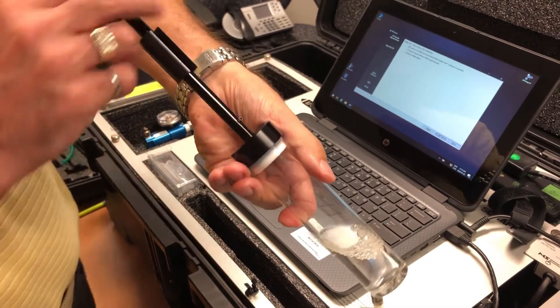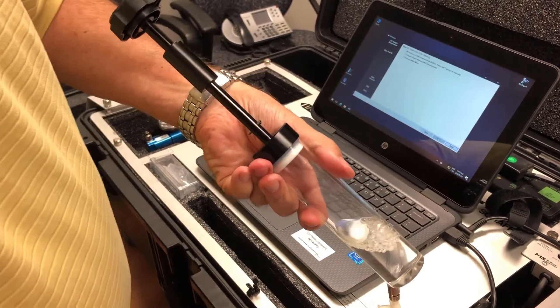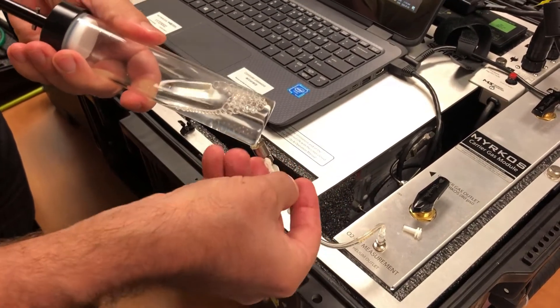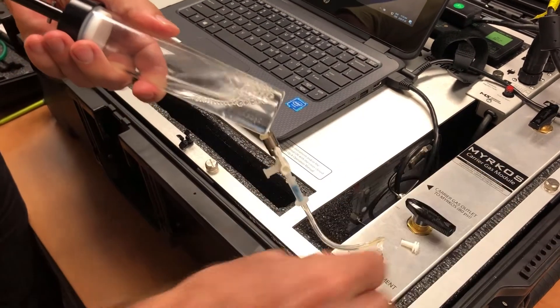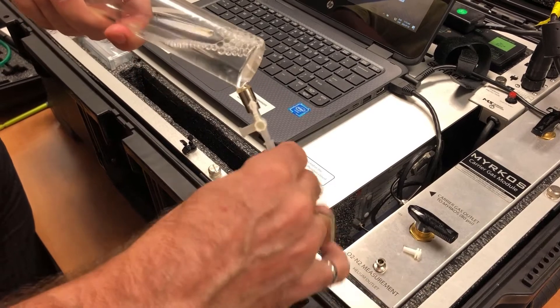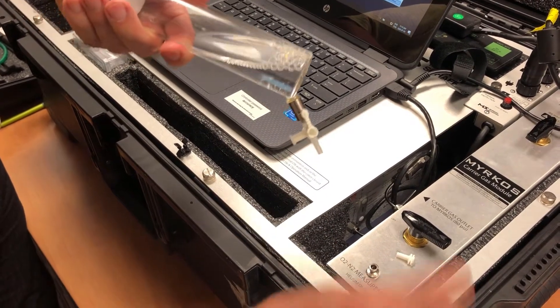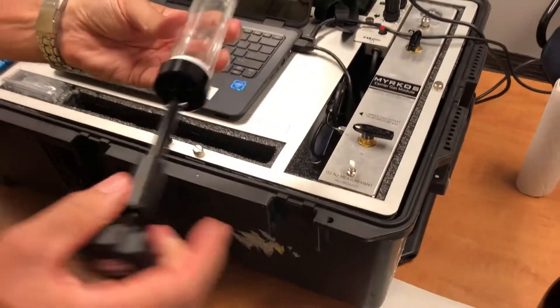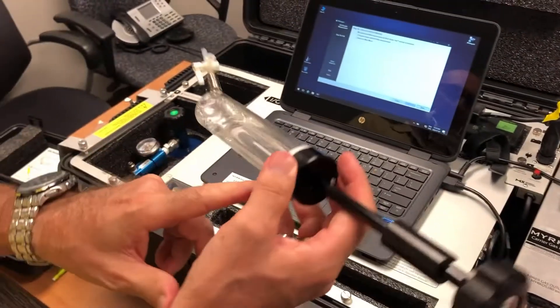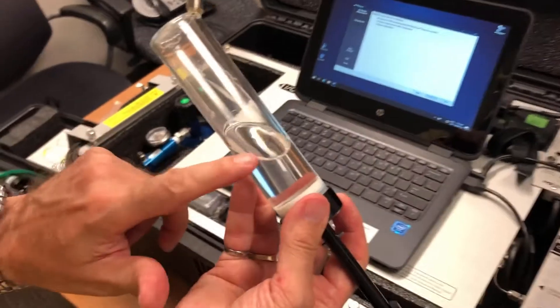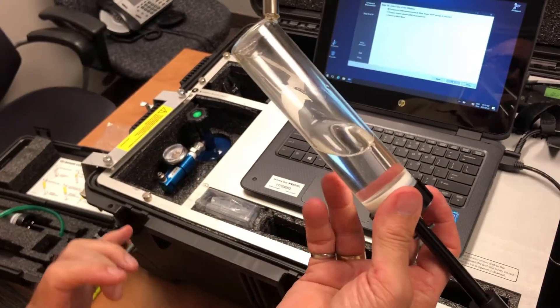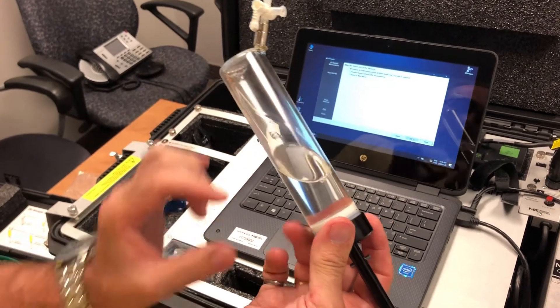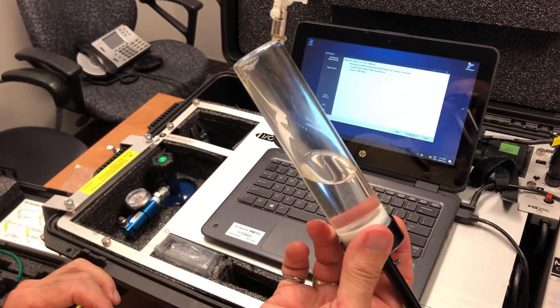So now we're full. So what we're going to do here is close this valve first, and remove the oil trap. So now, again, we have a certain amount of oil, much more larger headspace to take in consideration the very high level of PPM of oxygen-nitrogen. So what we're doing mostly is what we call a dilution.